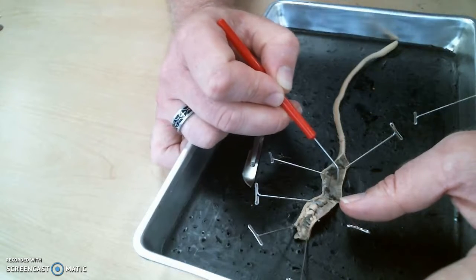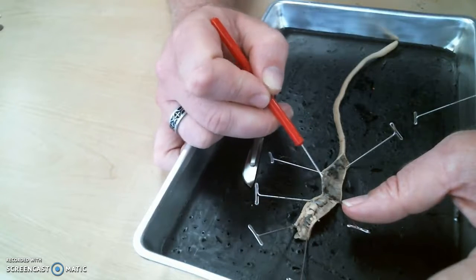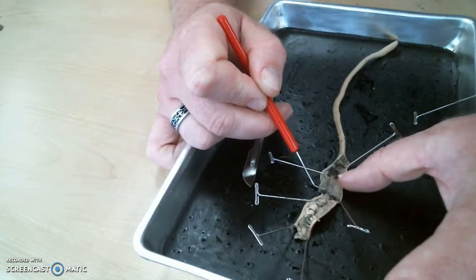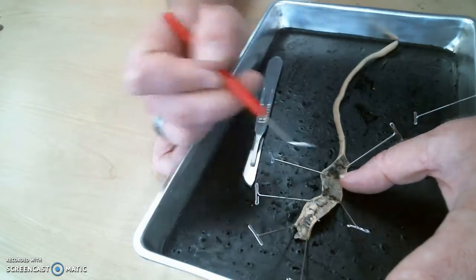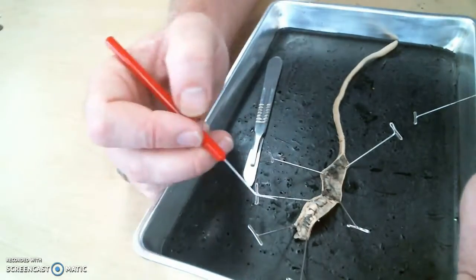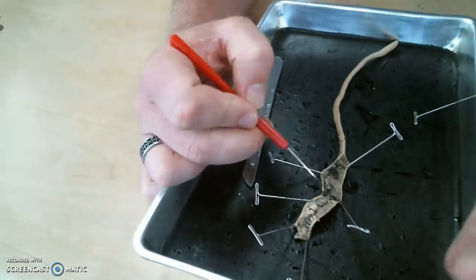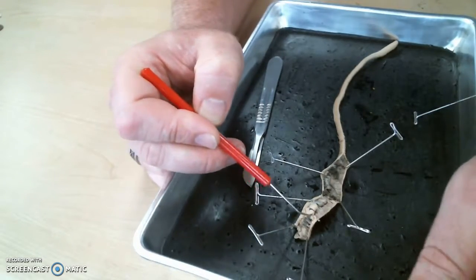And then underneath the intestine, if I carefully tease it up, there is that darker one that you can see through the skin, and it's right on the skin. I don't know if you can see it in the video, but it's right here. And that's the, what was that? Ventral. The ventral blood vessel. Good.